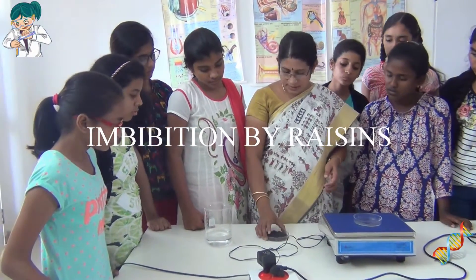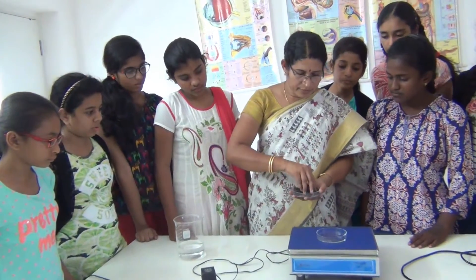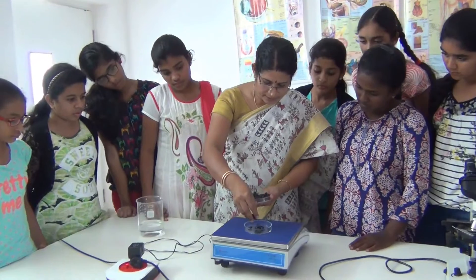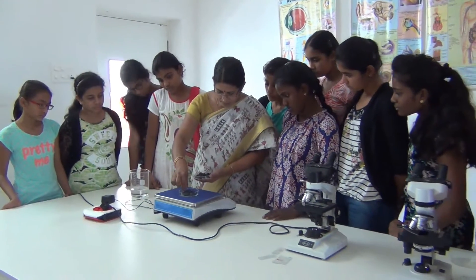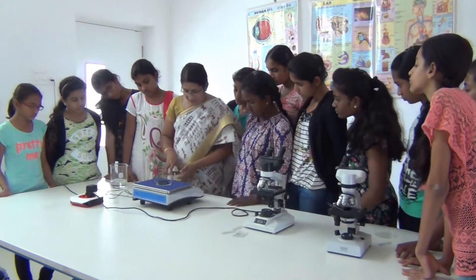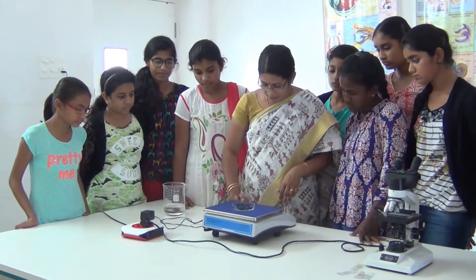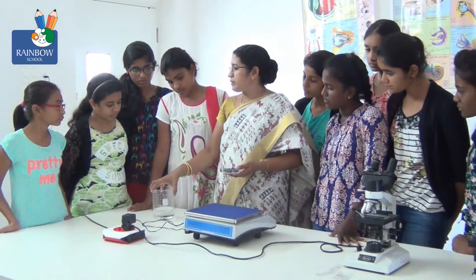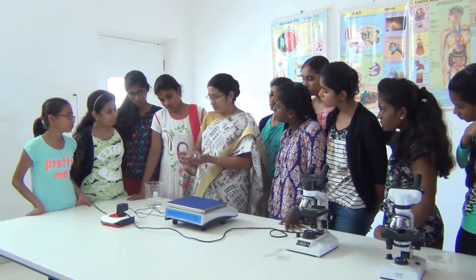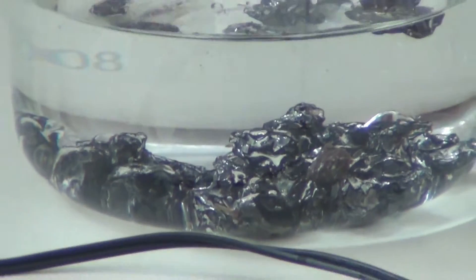So I have selected a few raisins. Now what we have to do is take the weight of these raisins. So we will take the weight — we get 15.3 grams of raisins. So this is our initial weight W1, which is 15.3 grams.